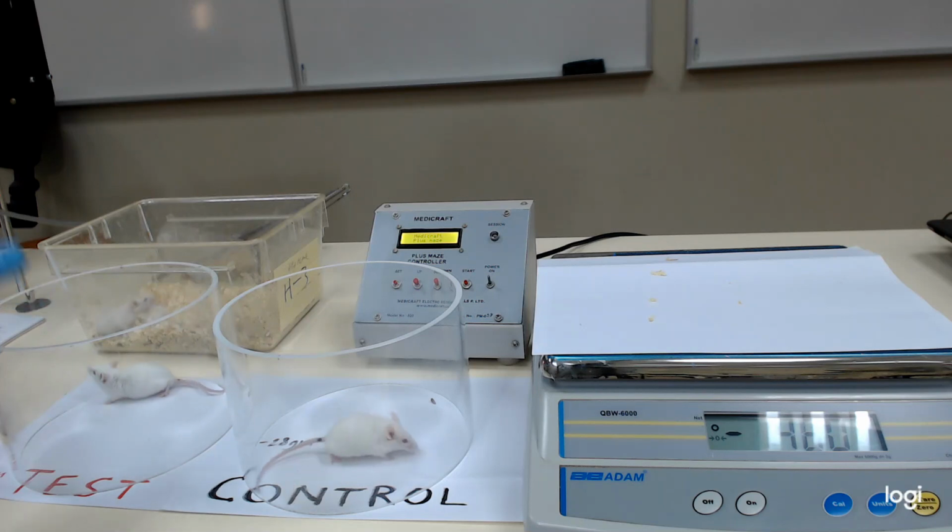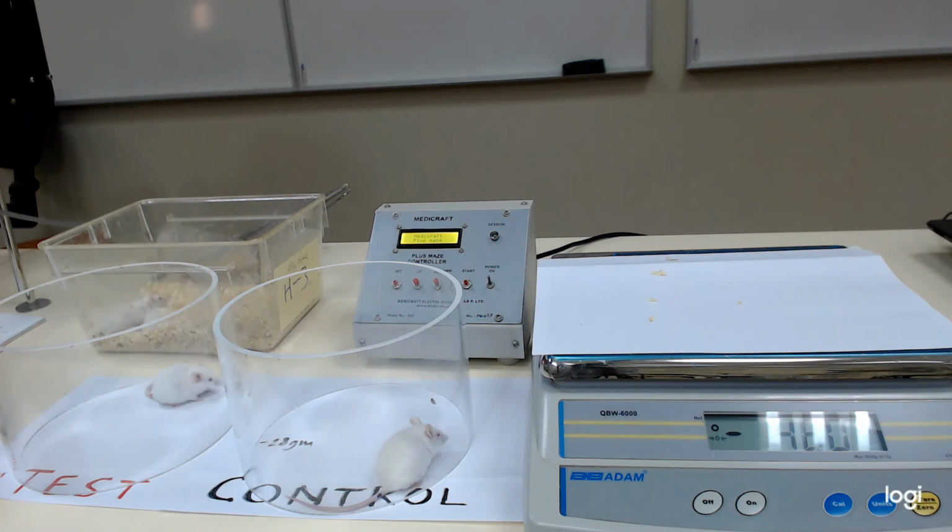After 1 hour, you have to go for the elevated plus maze test, 5 minutes for each animal. So you have to plan your injections in such a way that they are 5 minutes apart, so that there is one available apparatus, the elevated plus maze. Exactly after 1 hour you can start the test, and one by one the animals can be tested on the elevated plus maze.